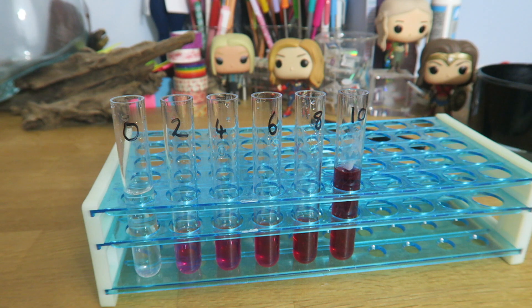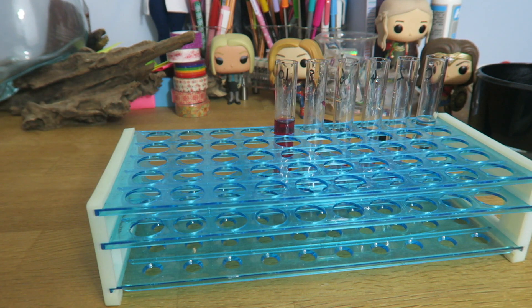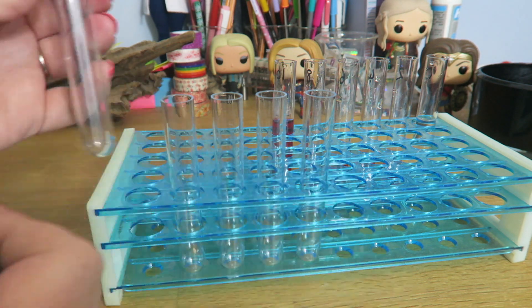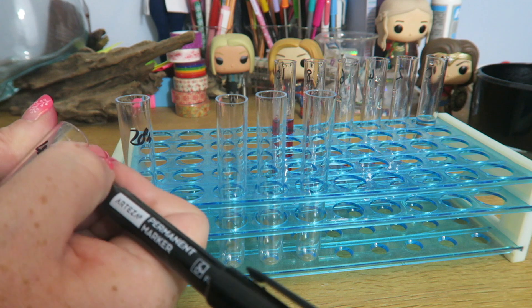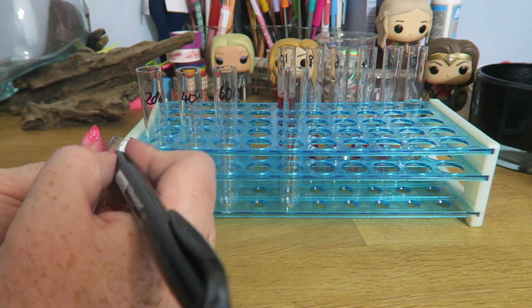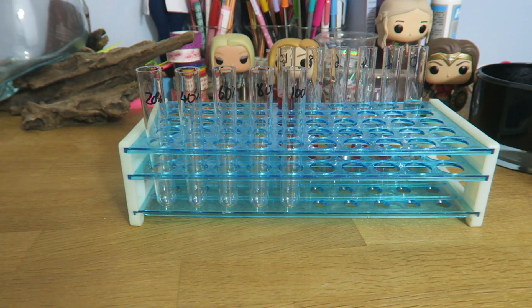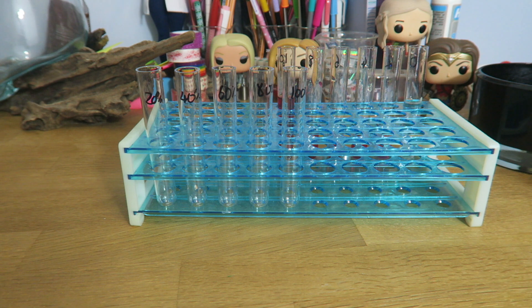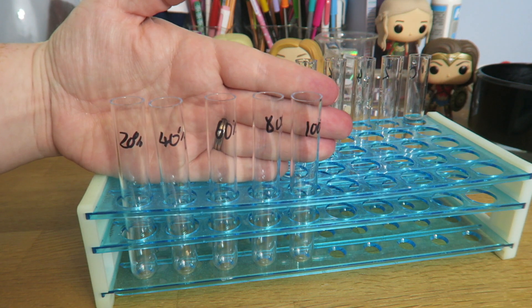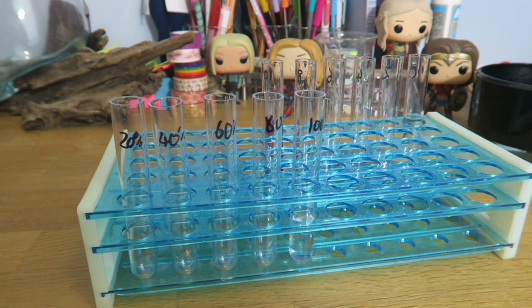I don't have a water bath, but I'm doing this in summer, so it is very, very hot. So, I'm just going to turn this around so we can have our second set of test tubes. So, we are going to have 20% alcohol, 40% alcohol, 60% alcohol, 80% alcohol, and 100% alcohol. And these are going to be probably already prepared for you, or if you have to dilute them yourself, then it is going to be done in exactly the same way that we just did the dilution series. We do not need much in these, because we're just putting small roots in there.